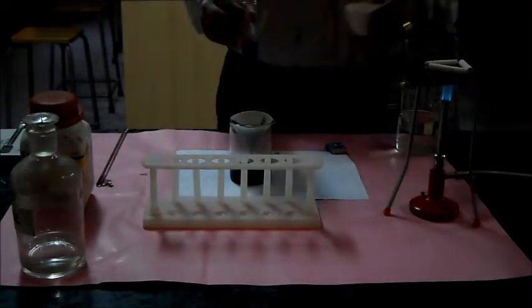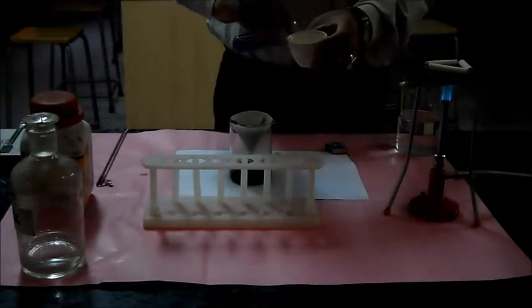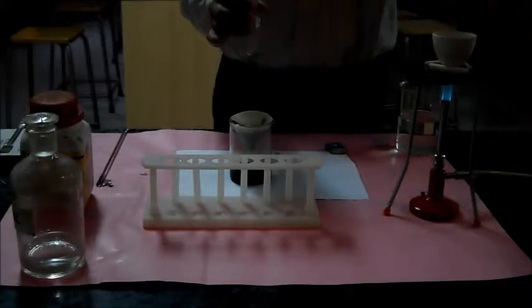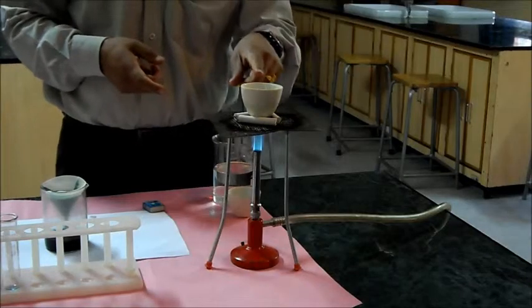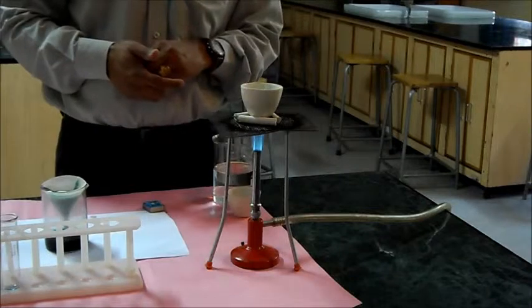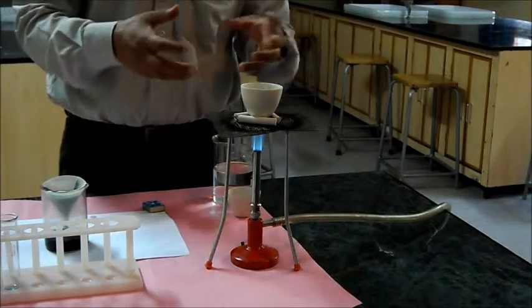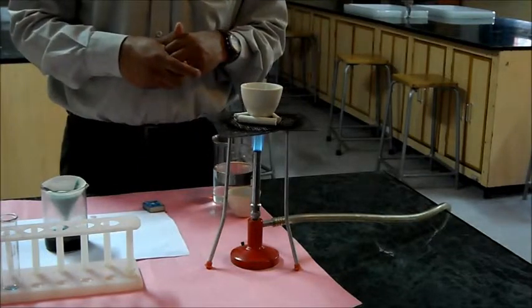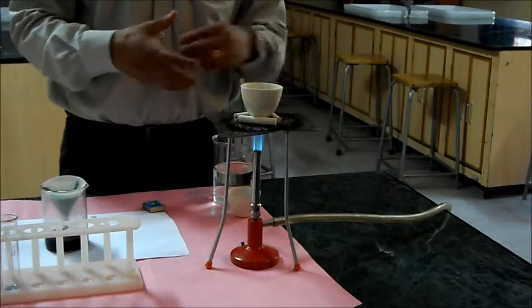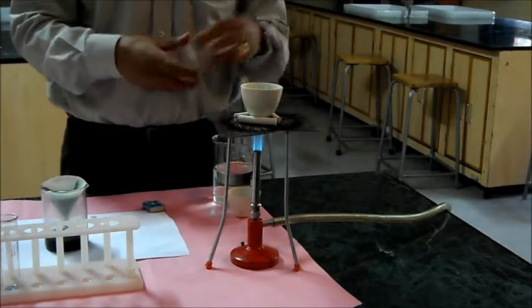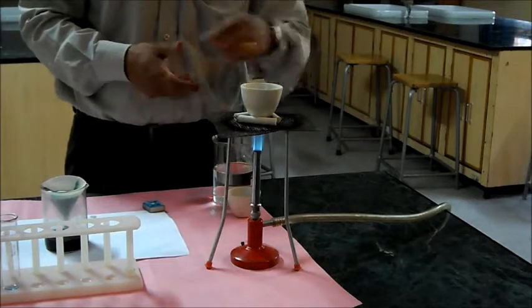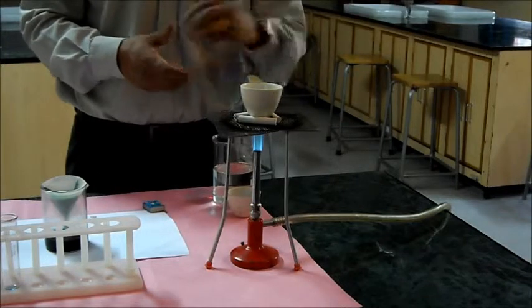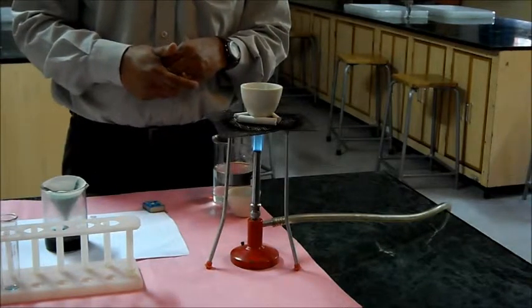For that, I take this into this crucible and keep it over this to dry. We heat the solution till the point where water is almost evaporated but not completely evaporated. This we do for some water to be trapped as water of crystallization and then we will get the crystals. If water is completely evaporated, the color of salt would be totally white.